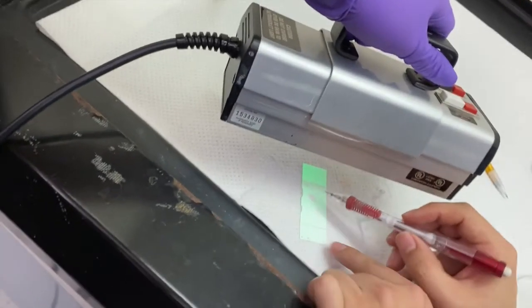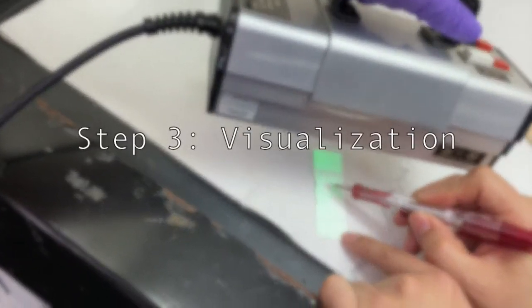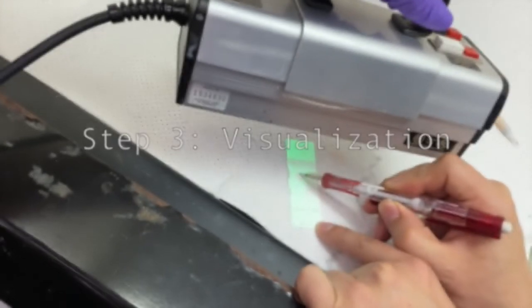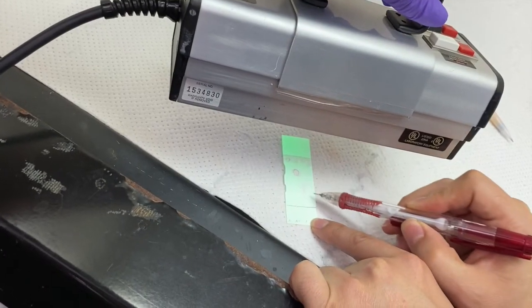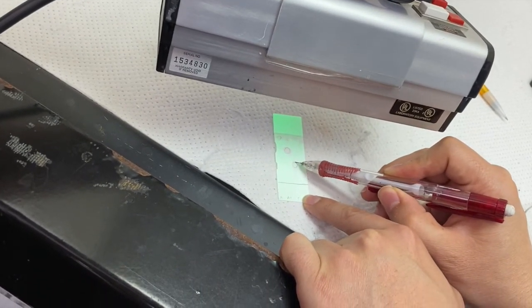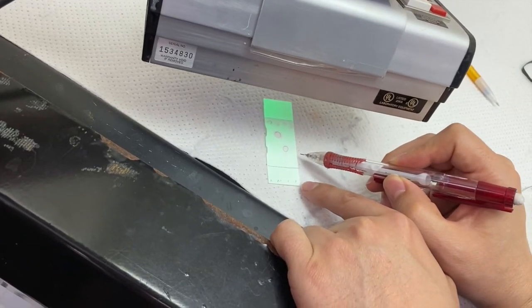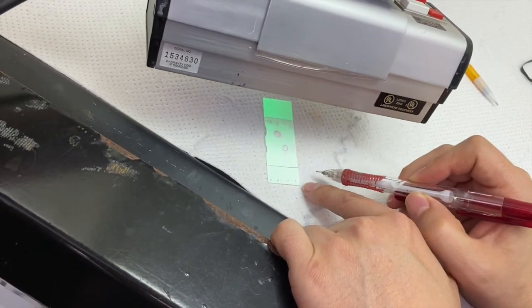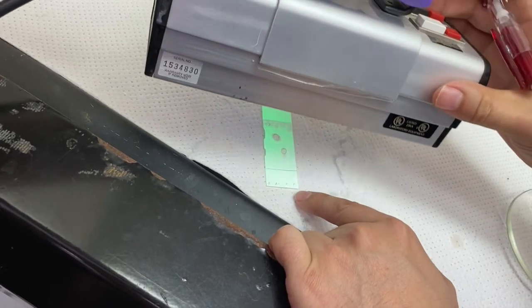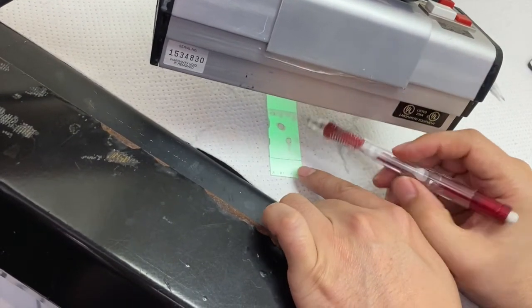Now it is time for the final step in TLC: visualization. Keeping your TLC plate on the watch glass, locate the hood which contains a UV lamp. Hold your plate underneath the lamp and sketch the approximate locations that each of your samples have traveled. Compare the distance traveled for each of your samples — this will tell you which samples have the same active ingredients.